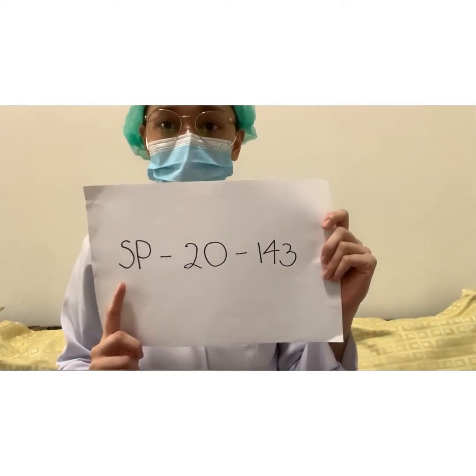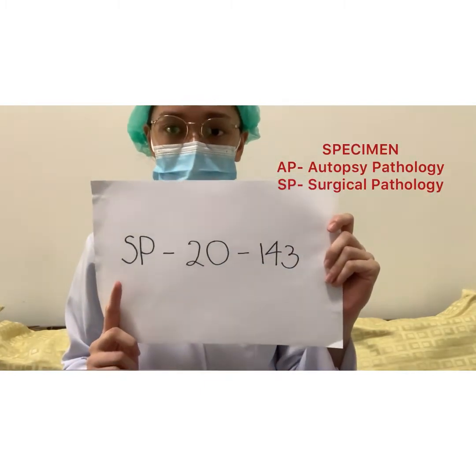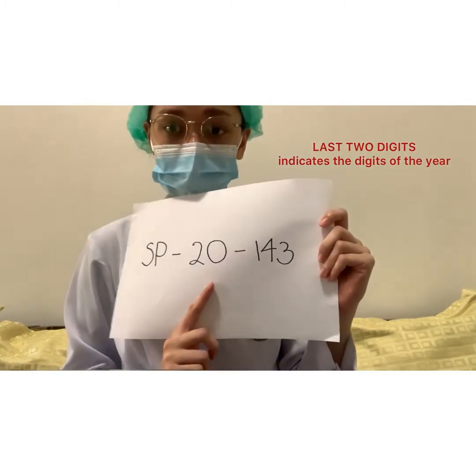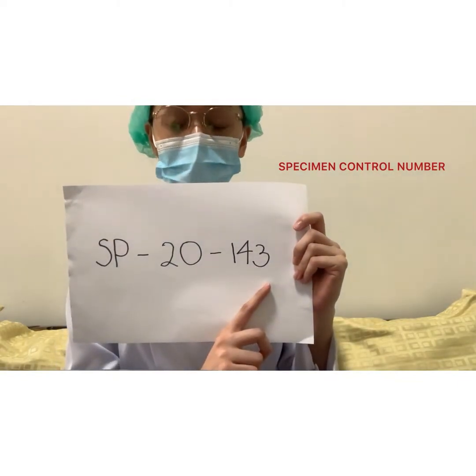This portion indicates AP for autopsy pathology and SP for surgical pathology. The last two digits are meant to indicate the digits of the year. This part indicates the specimen control number from the specimen.